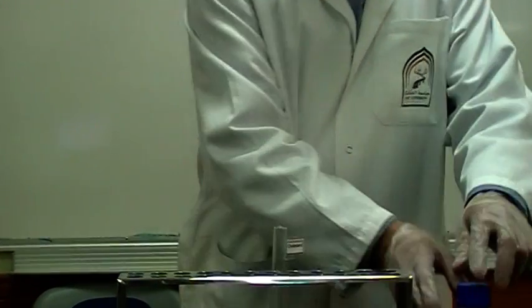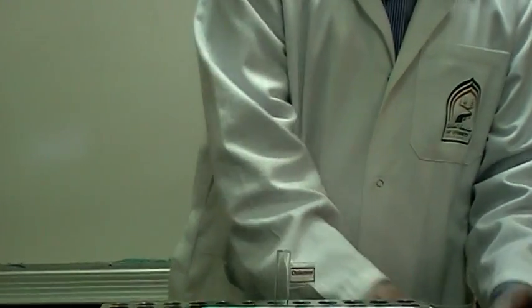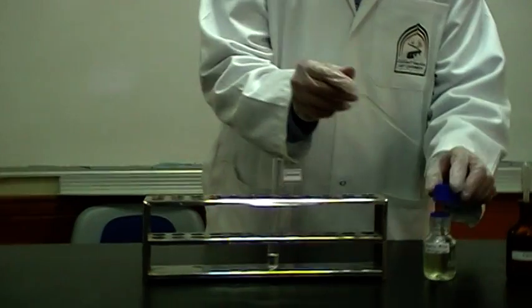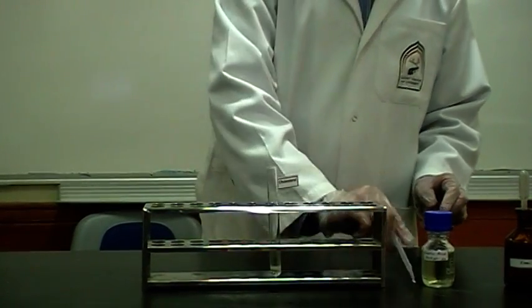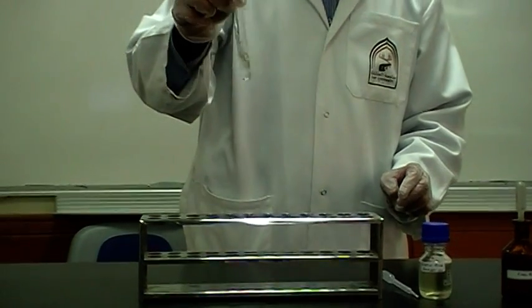The order is so important. Start first with adding equivalent volume of acetic anhydride to cholesterol. Then you need to shake very well.